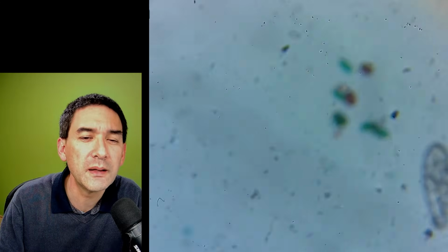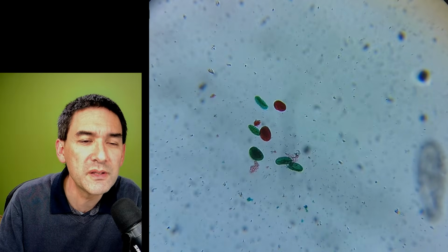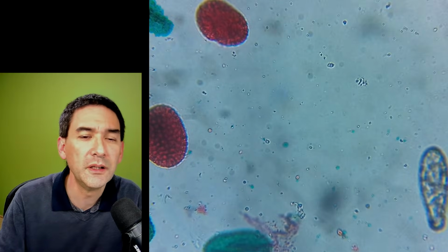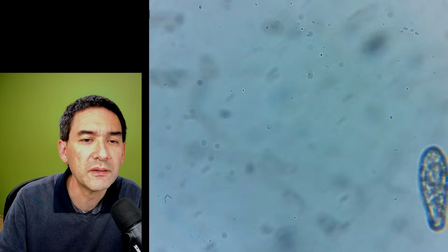Yeah, but you see, that's always usually a thing. The quality sometimes is very different. Yeah, here that's some pollen. Let's go up. Here we go. Yeah, this is also stained. I lost it here.